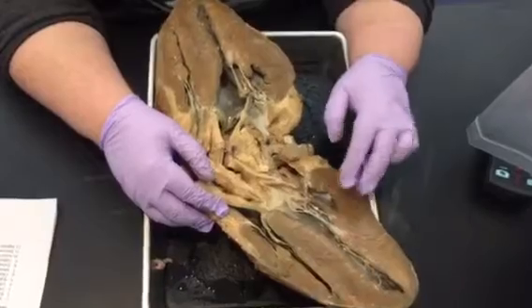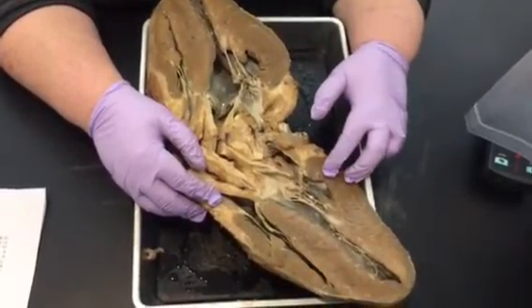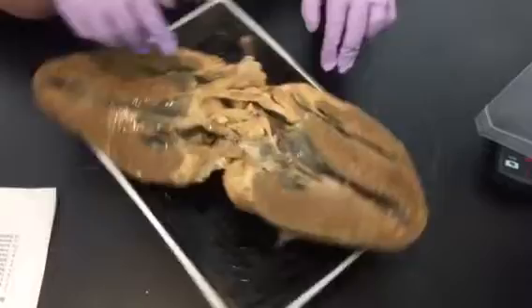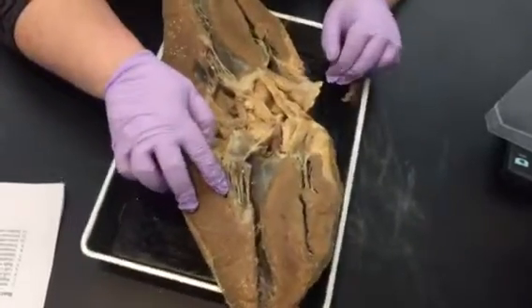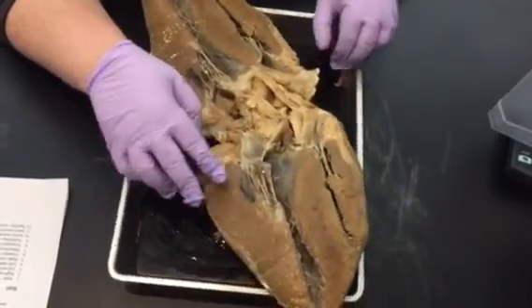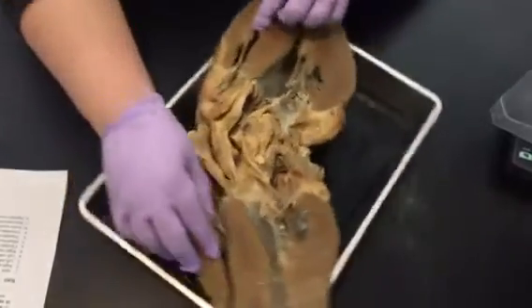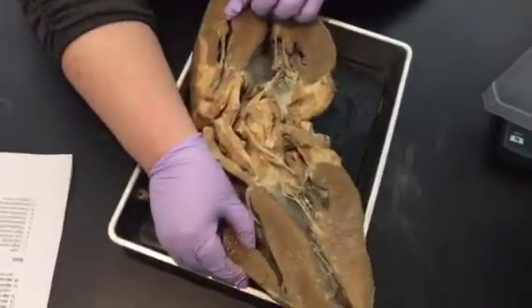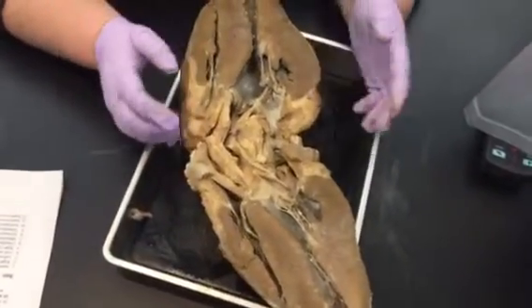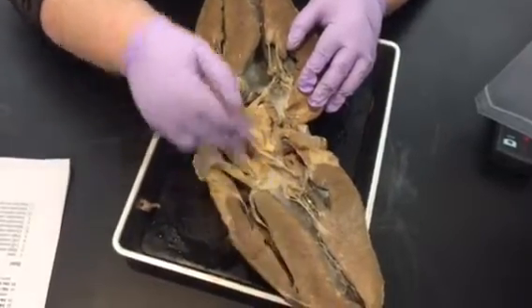When you crack it open, a nice easy way to tell the difference: the wall of the left side is always thicker. So no matter which way I'm looking at this, the wall of the left side is always going to be thicker. Notice the right side — very thin in comparison. So this is the left ventricle, that's the right ventricle. Up above these chambers, this is the left atrium, this is the right atrium.